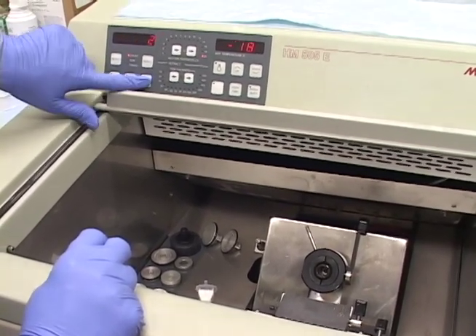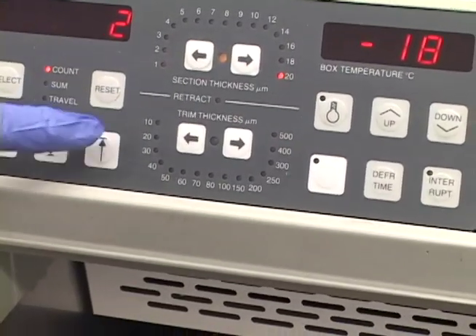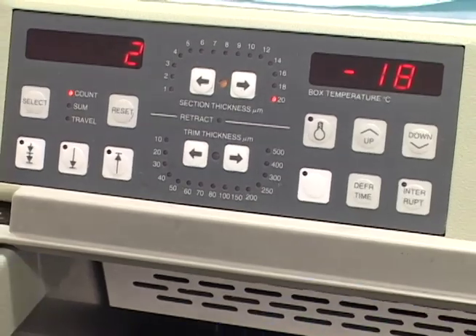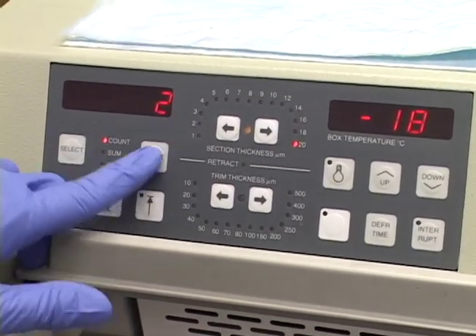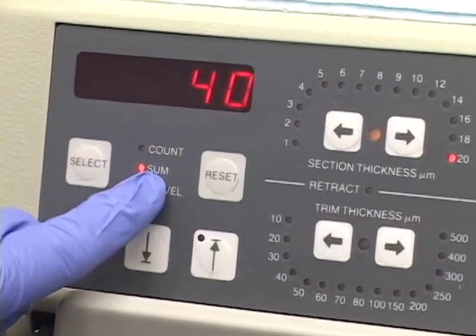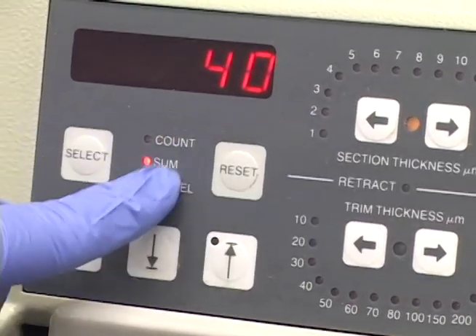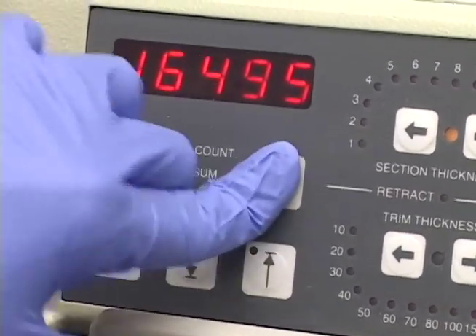I'm going to turn that off because I don't want it to rapidly do that. But if I press and hold, I need it to go back faster; if I want it to stop, I press it again. This does a counting — it'll tell you the sum, the actual count, how far it's traveling forward. You can just reset it.